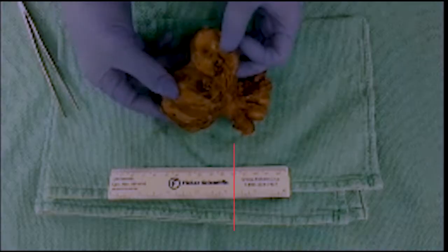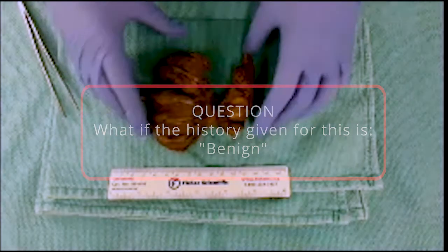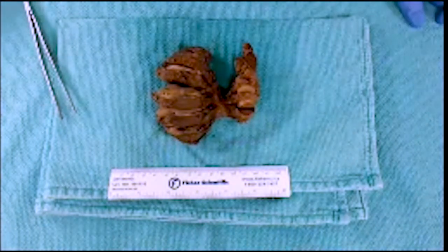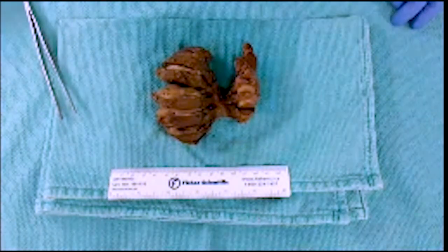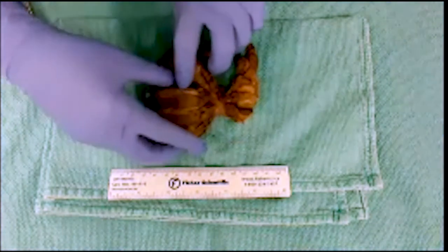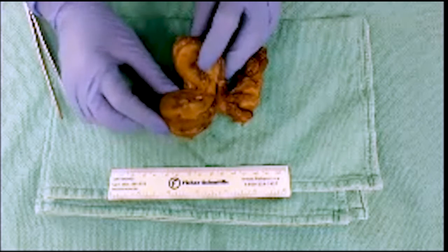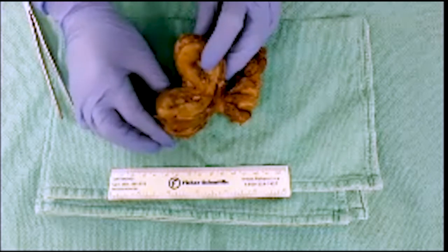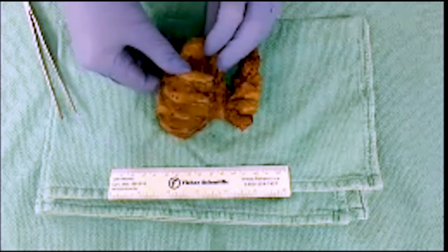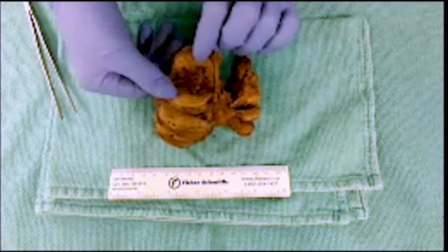Now let's switch gears. What if the history was actually saying benign? If we had an FNA showing a benign lesion, we'd want to do more representative sections through the mass. If you see a mass that is very heterogeneous with cystic and necrotic areas, that would heighten my suspicion and I'd submit those areas more heavily. For a large neoplasm I would consult peers or a pathologist. If it is homogeneous and the FNA says benign, I would be conservative and representative.